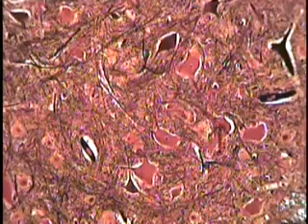Examine these very large cells or neurons for the same cytological features as observed in ova. This is a nerve cell or neuron located at the tip of the pointer here, one here, and one here. Note that the cytoplasm is drawn out into very large elongated processes called dendrites, and occasionally an axon may also be observed, though we can't distinguish one from the other on this particular section. Note that the nuclear profile can be observed in some of these cells, as well as the dark central round body — the nucleolus — in the center of the nucleus.